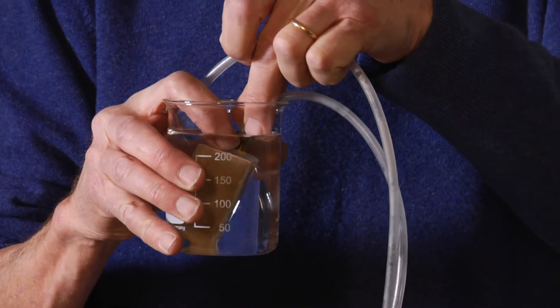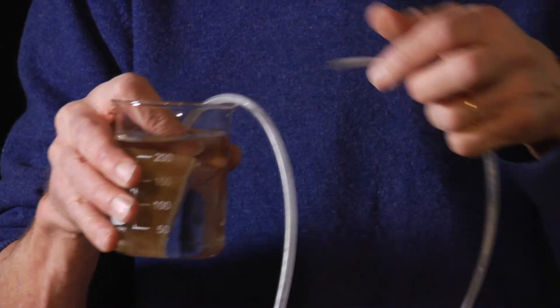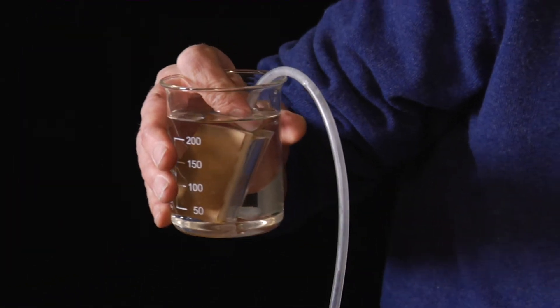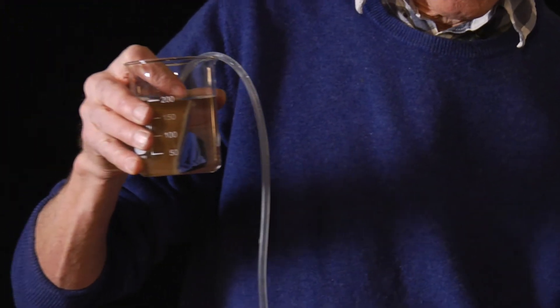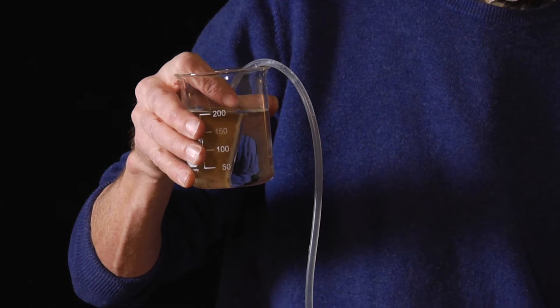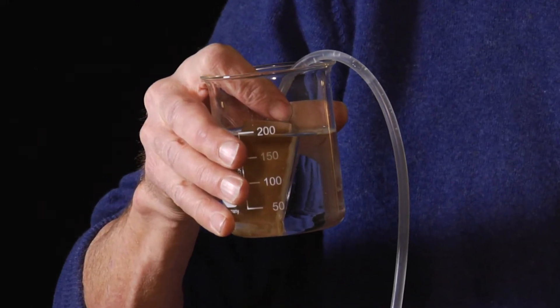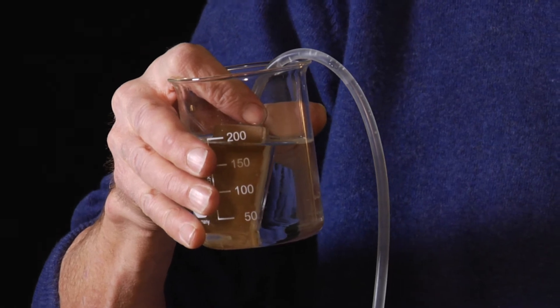I start by filling it with water by sucking, creating a siphon by lowering the open end of the tube. As you can see, it is permeable to water.